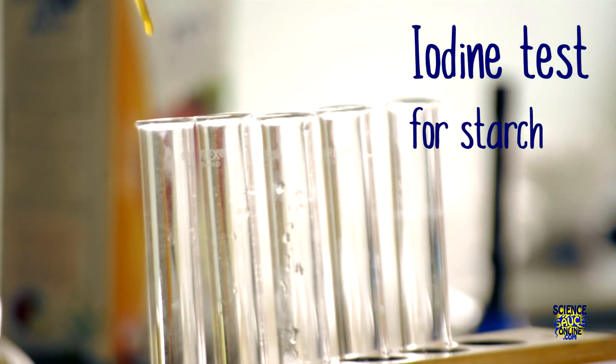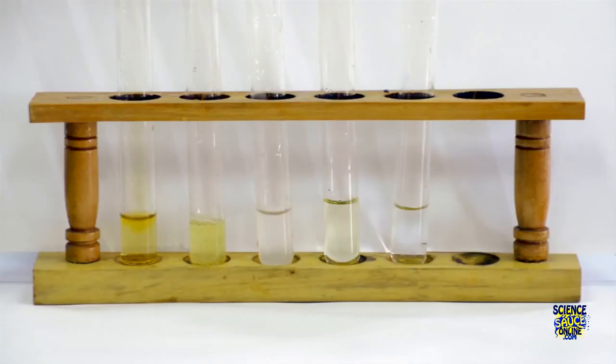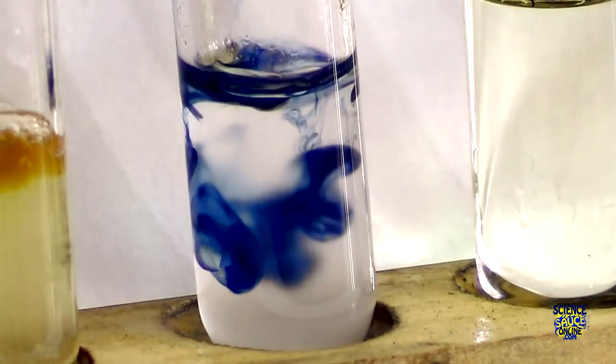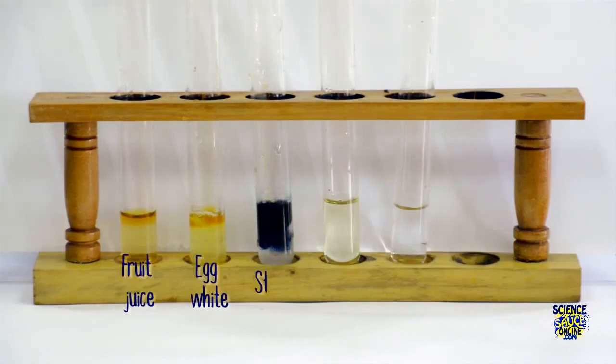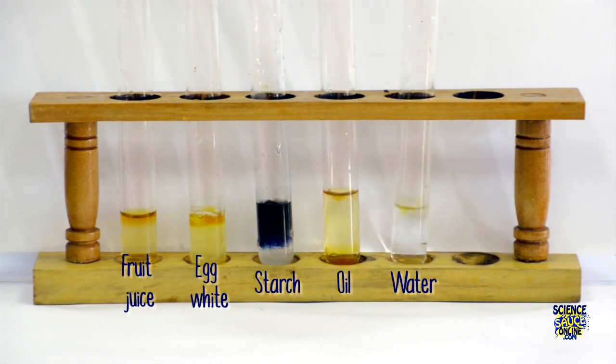First, take your iodine solution and add it dropwise to each of your samples. Notice that the iodine is a kind of orangey colour, and when we add it into our samples, that orangey colour remains, until we add it to the starch solution and there's a clear blue-black change in colour. We continue adding this to all of our samples, and amongst all of them, starch is the only one that shows a positive result.